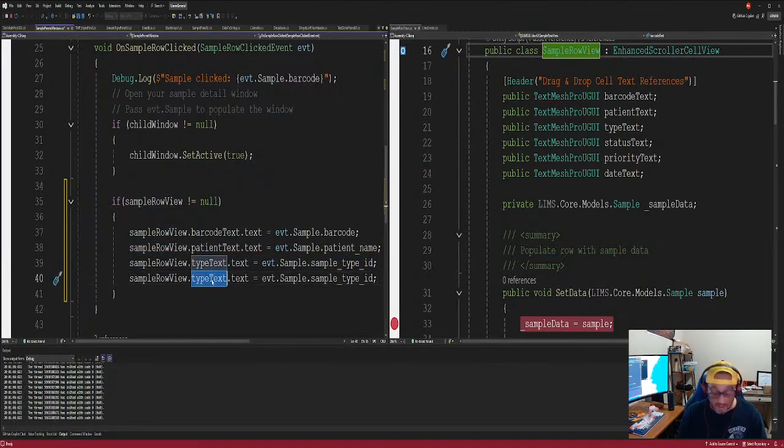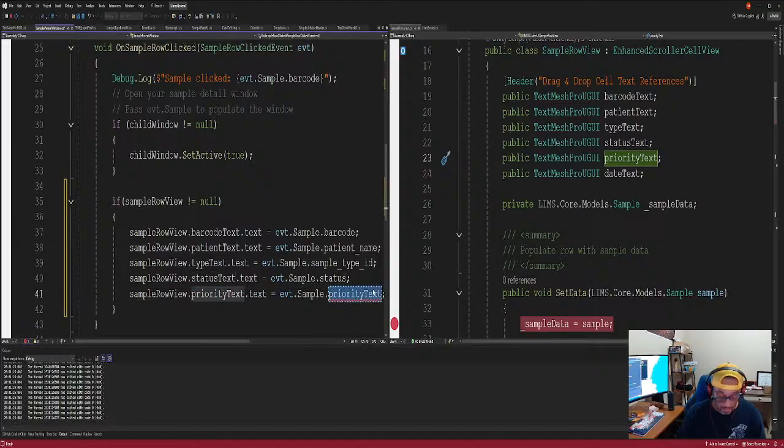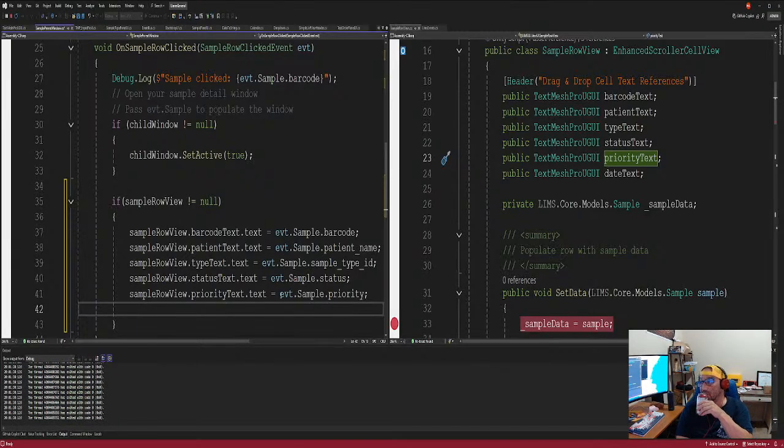Type text, status text. Oh man, status text. No, I'm thinking about what I gotta do tomorrow. But get through this right now. Priority text. Priority text. Priority. Yeah, we gotta fix these. When you name the column names, you have to name them the same. If not, it gets confusing.